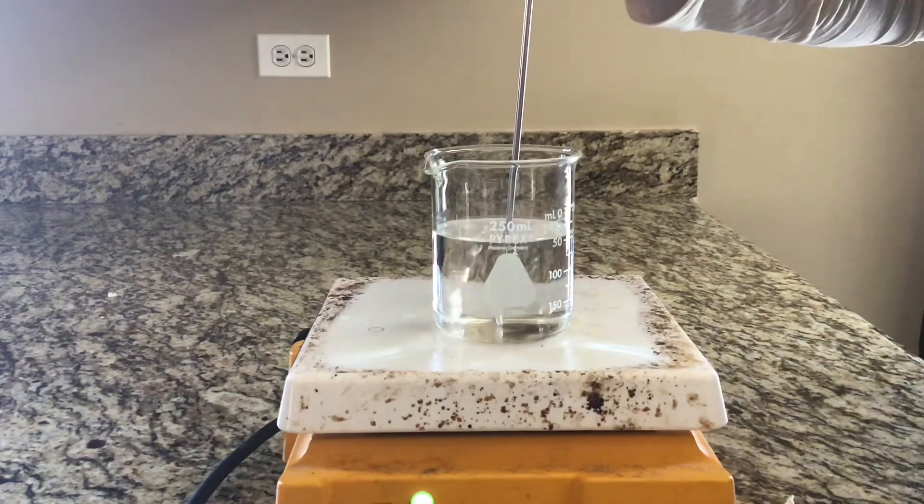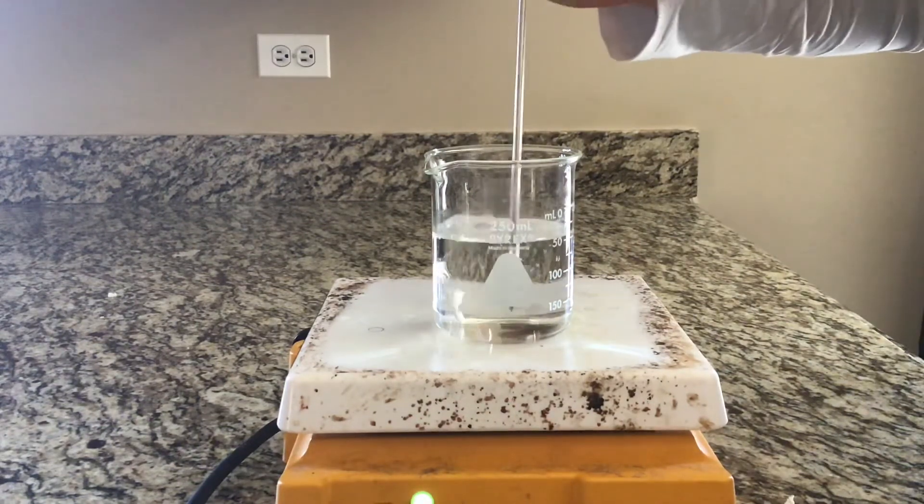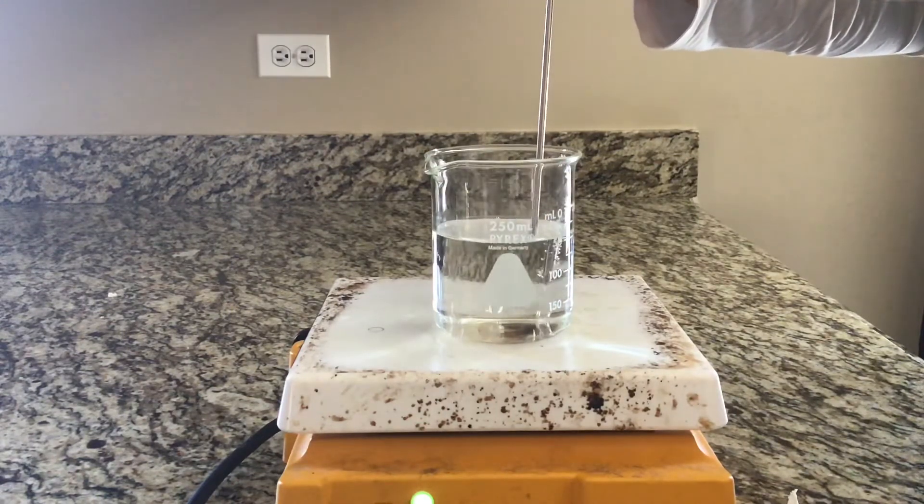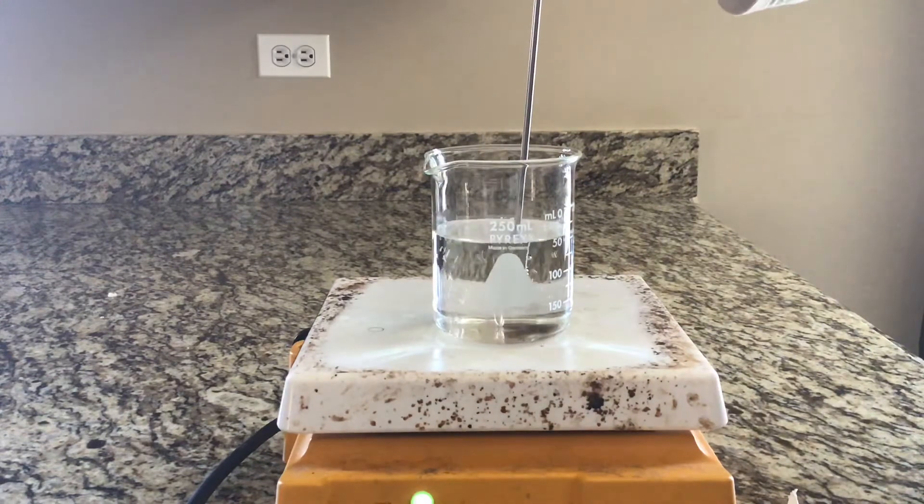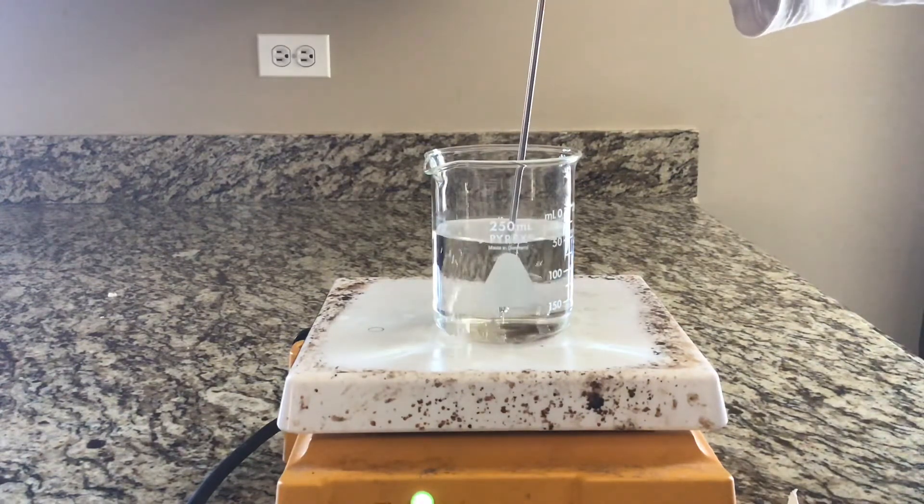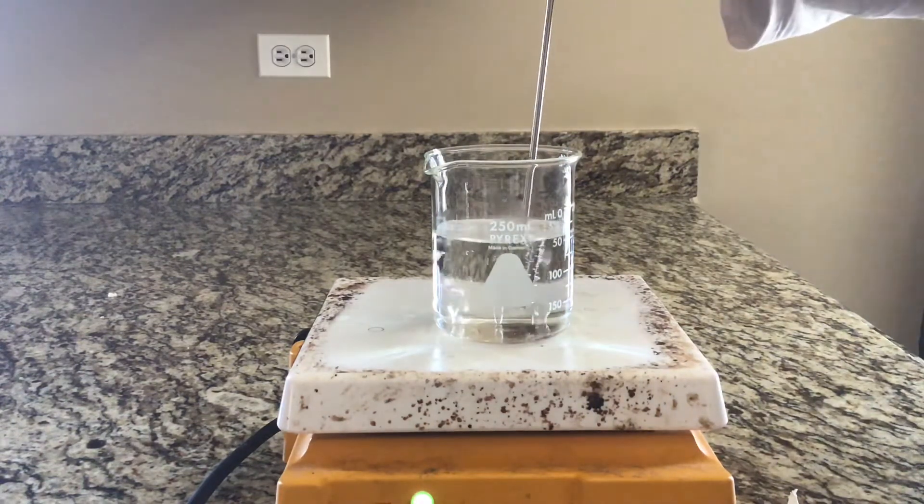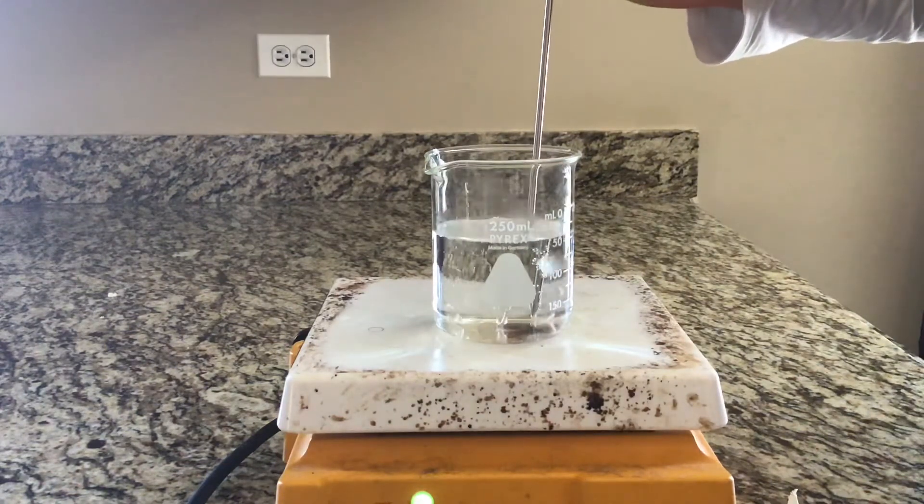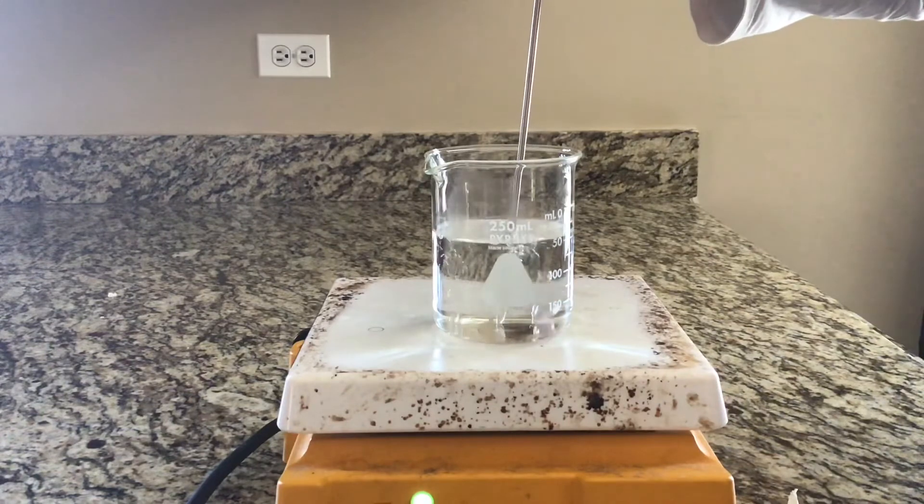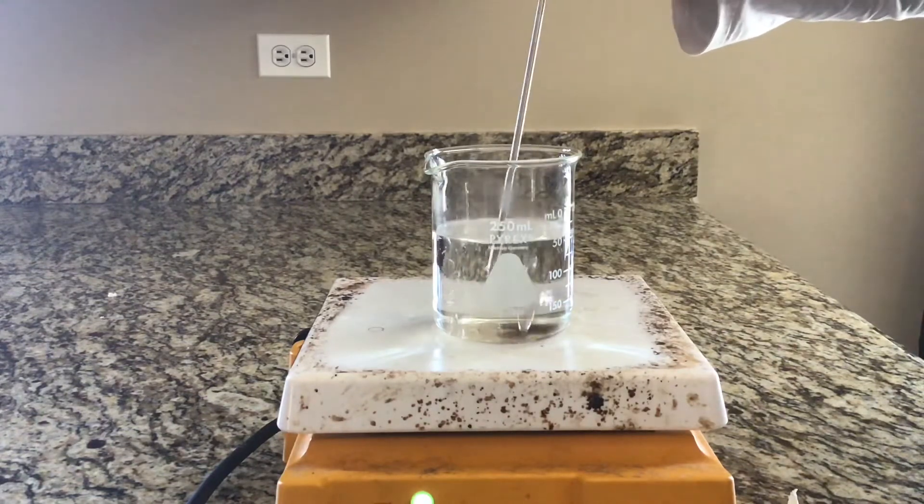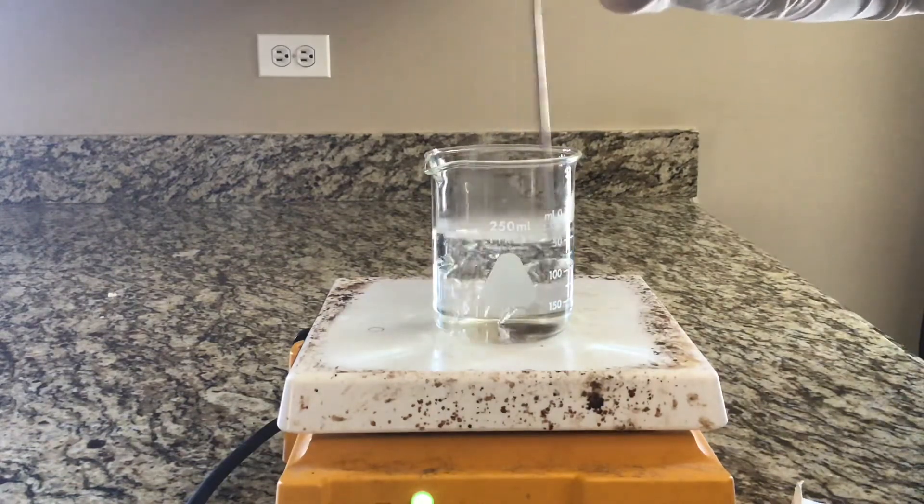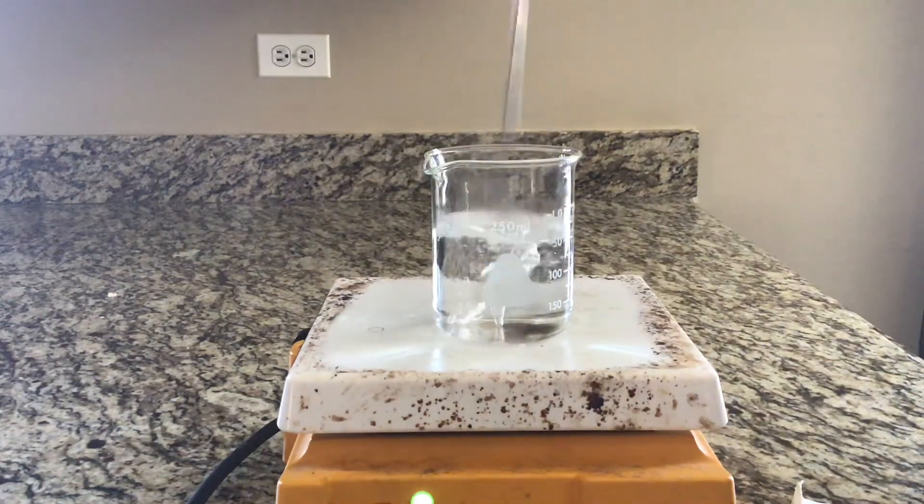Getting closer. At 13:20 the temperature is 97.5 degrees. Looking close to boiling, not officially boiling just yet, almost though. All right, 13 minutes 40 seconds, the temp is 98.7. Keep stirring this.